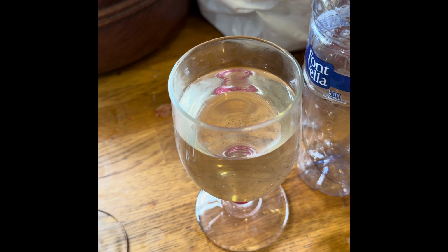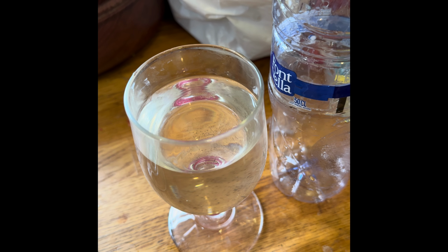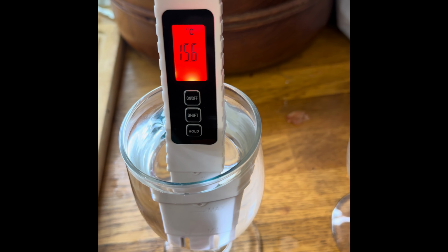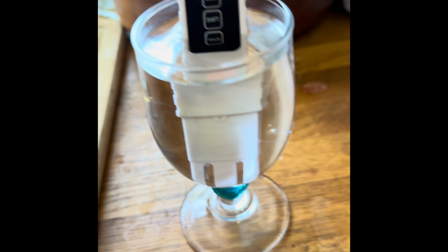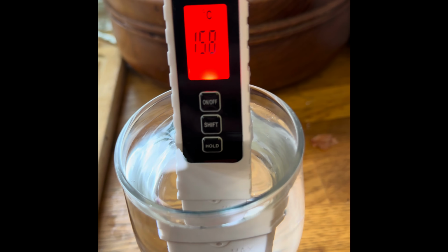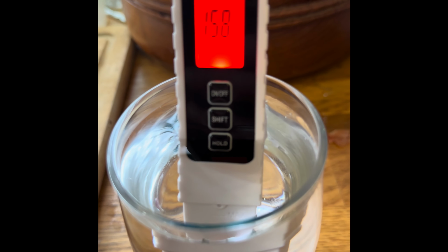I've now poured a second glass of water from the tap. So the one I'm looking at now is the pond water, the bottle next to it. And then there's a new one which I've just taken out of the tap, and that's 15.6 degrees. I'm colour coding them, so the blue one is the tap water, and then the purpley coloured one is the pond water, so don't drink the wrong one by accident. So the tap water now at 15.8, so I'm just going to change this over to measure parts per million.